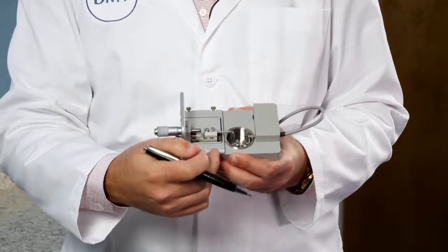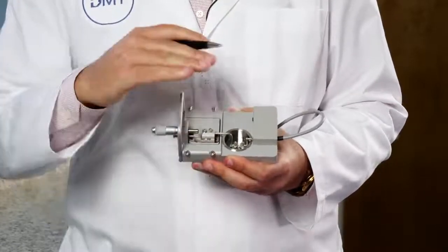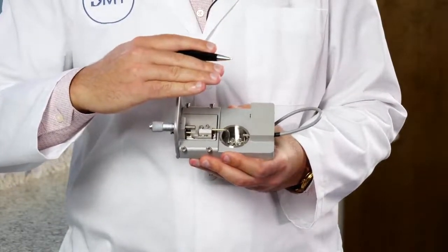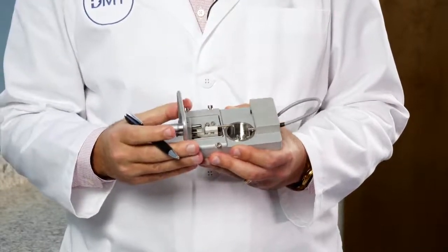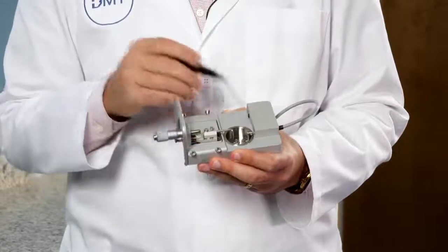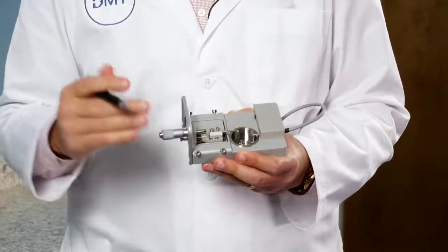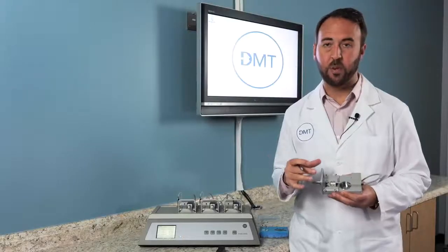So as you tighten the front right screw, it's going to push the chamber down and to the right. You will keep that in mind as you try to align your mounts. You want the jaws to be level and touching at the same time on both sides.